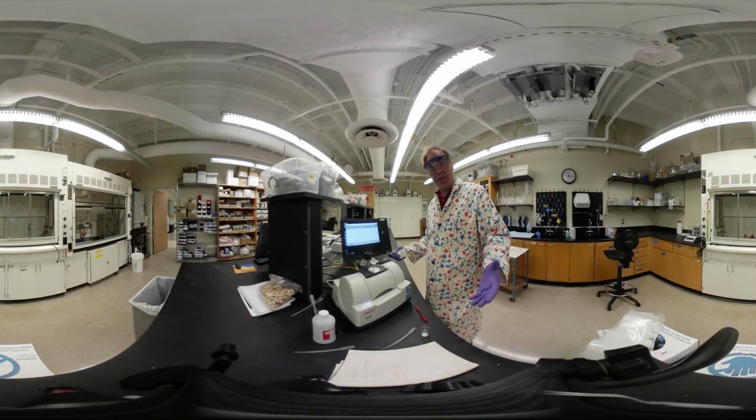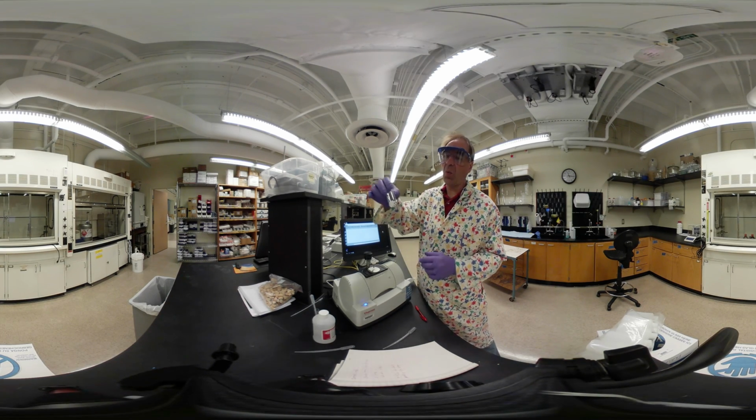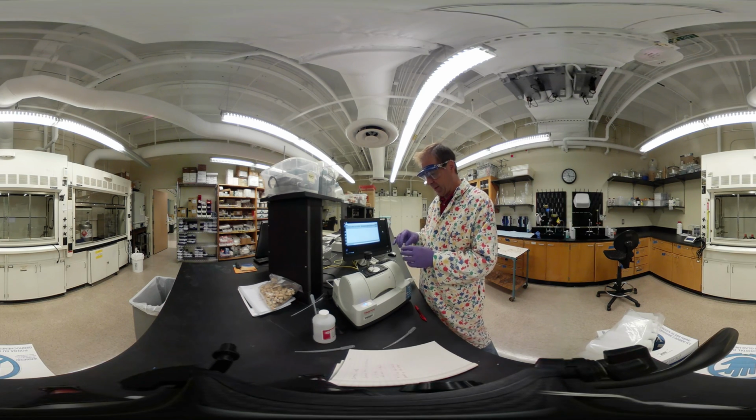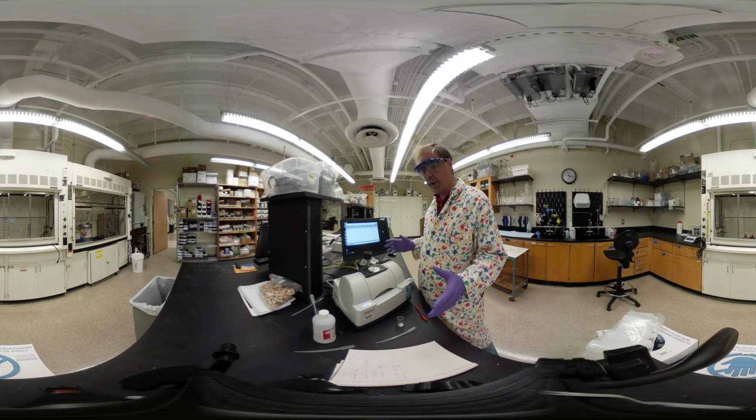Now it's time to do some analysis for our Dmap lab. We've done the reaction. I collected our white solid material. I calculated its mass so we can get a percent yield. So now we're going to look at the infrared spectrum of this.